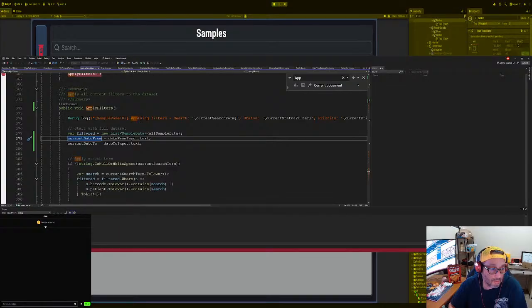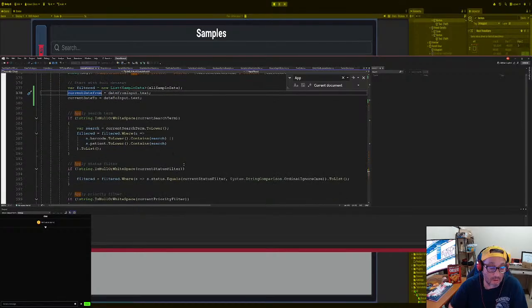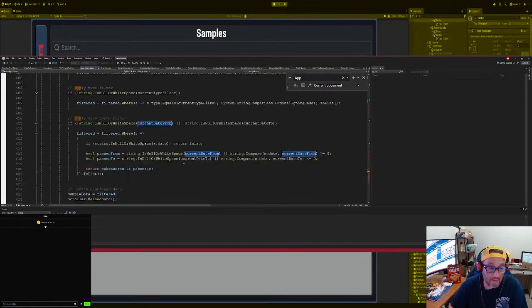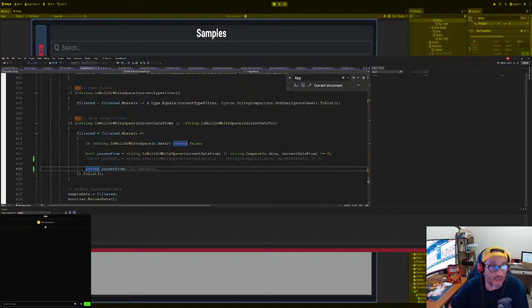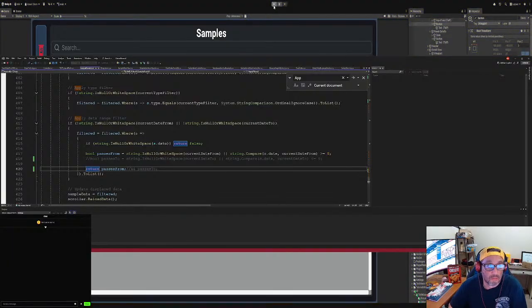Yeah, but the date after, so do that here. No. We do that here. No. And let's see. Date after, date after, date after. Okay, so we do it here. Date after. Passes to, passes from. So this one is wrong right here. Okay, so filtered, when we filtered everything they from this, just do that from here. I just want to make sure I got everything correctly. My logic might be off.